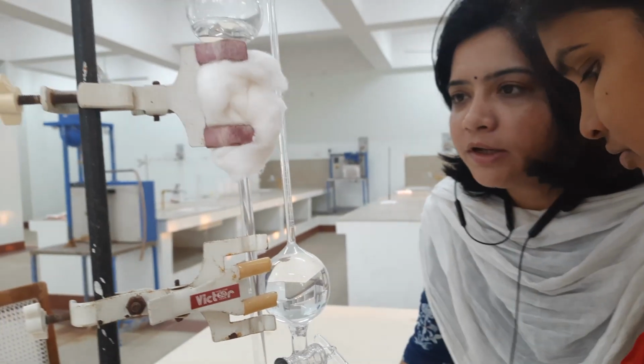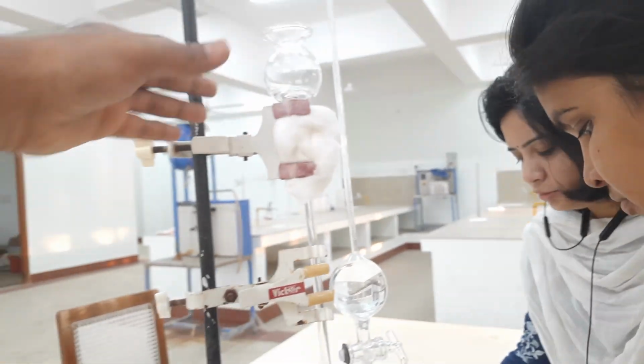So at 4 minutes, we got the reading to be 7.2. We note this down.